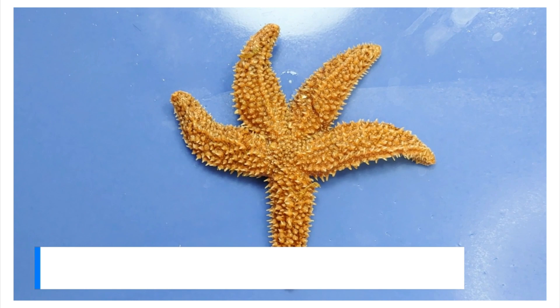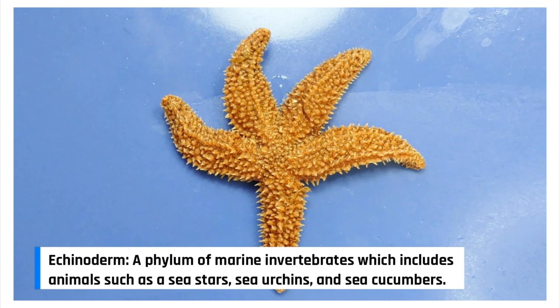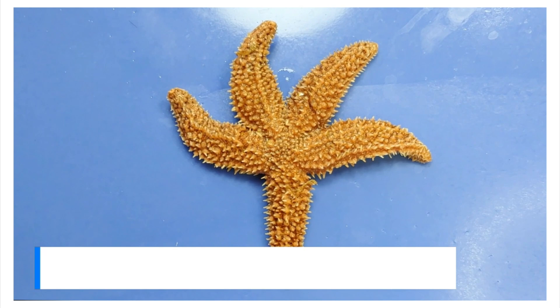The sea star is actually an echinoderm, which is a phylum of marine invertebrates. Other members of this phylum include the sea cucumber, the weird cousin; the sand dollar, the successful cousin; and the sea urchin, who never shows up to Thanksgiving dinner.